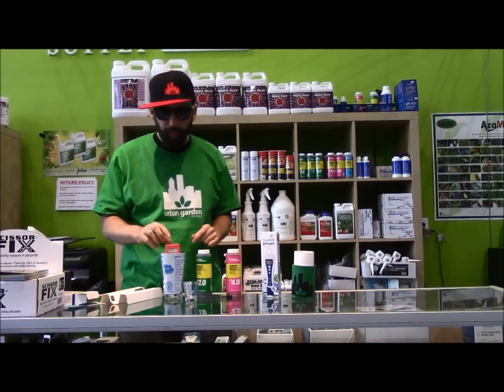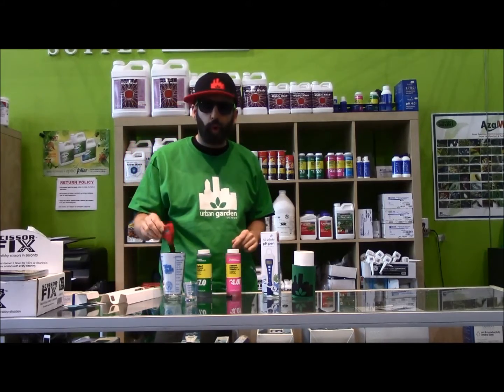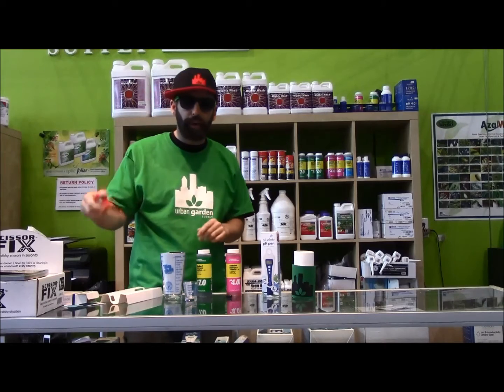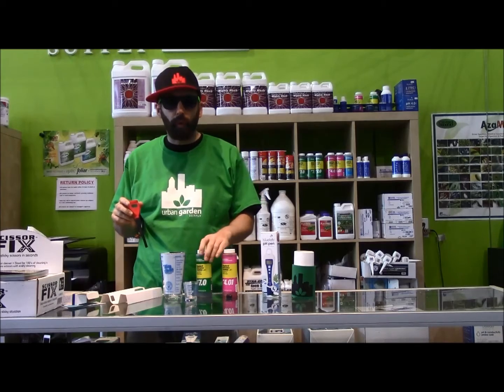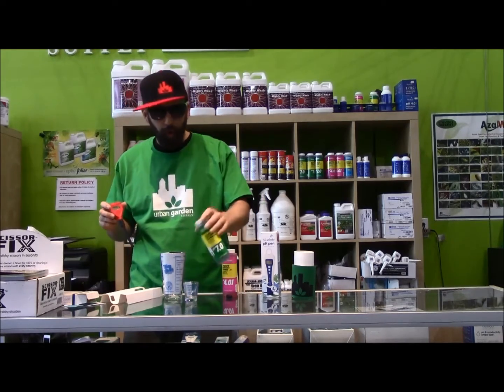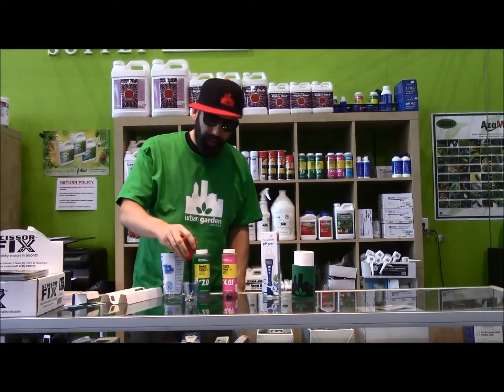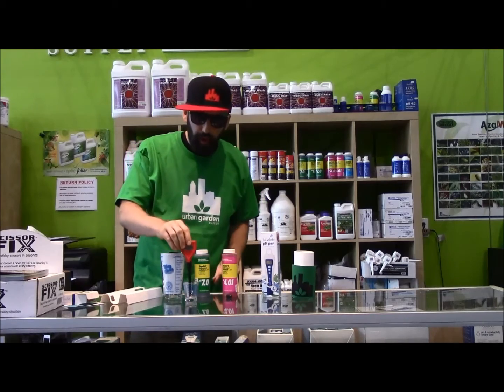24 hours is pretty magic-tastical. After that 24-hour soak, go ahead, pull the probe out, shake off any excess water, and you could start with pH 4 or you could start with pH 7. Go ahead and fill that guy up and get that probe in there. You just need enough of the solution to cover the probe.